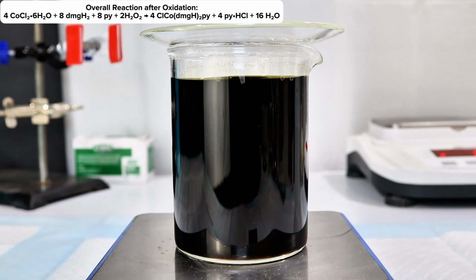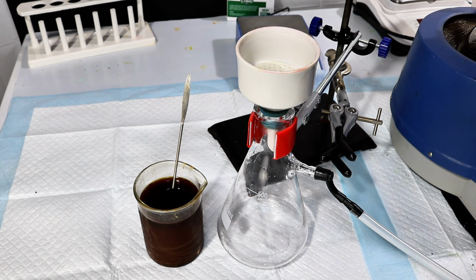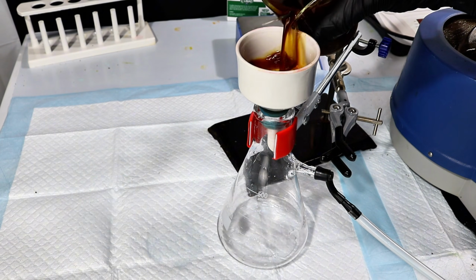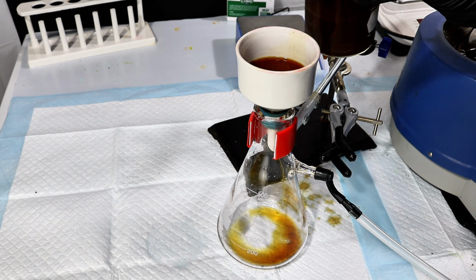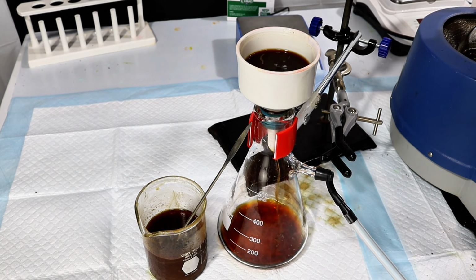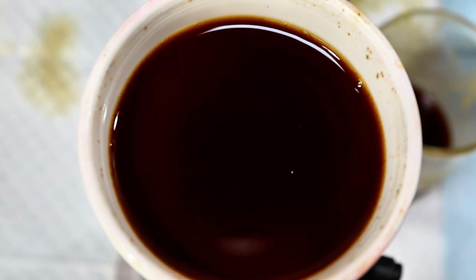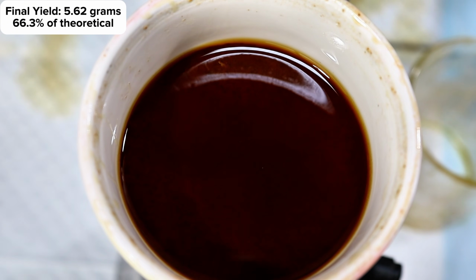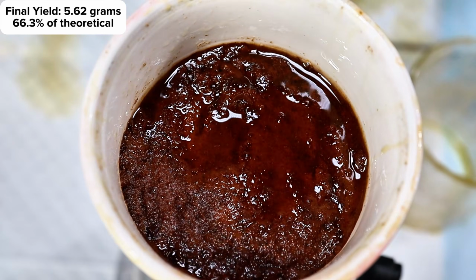This is done by once again adding 15 milliliters of 20% hydrogen peroxide and allowing the complex to sit and react for a while. After about 20 minutes of reacting at room temperature, the solution was cooled on an ice bath, which crystallized the product from solution. It was then collected by vacuum filtration, dried overnight, and weighed for a final mass of 5.62 grams, representing a 66.3% yield.